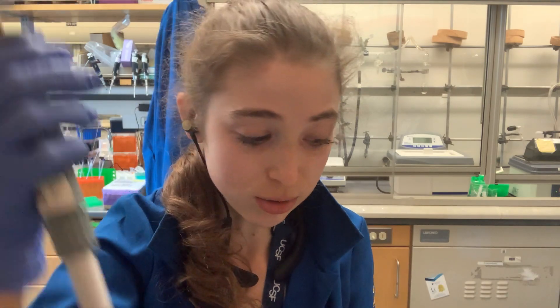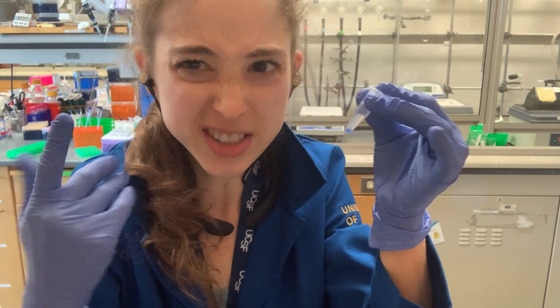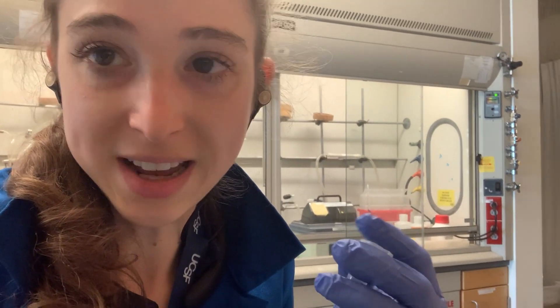Which is why sometimes a finger vortex could be a better alternative so you're not losing liquid stuck to the tip. You might think, why don't you just centrifuge it? Centrifuges — it's like a mixer, right? Well, what a centrifuge is actually doing is separating things out by how heavy they are, especially if you centrifuge really fast.